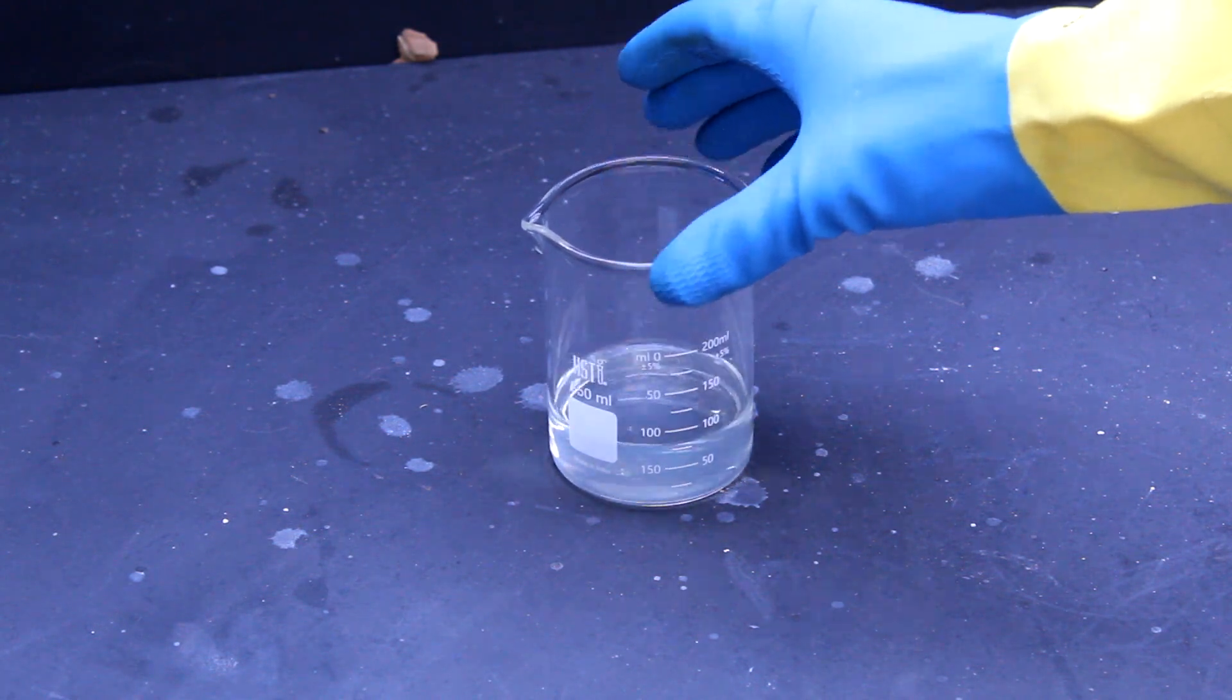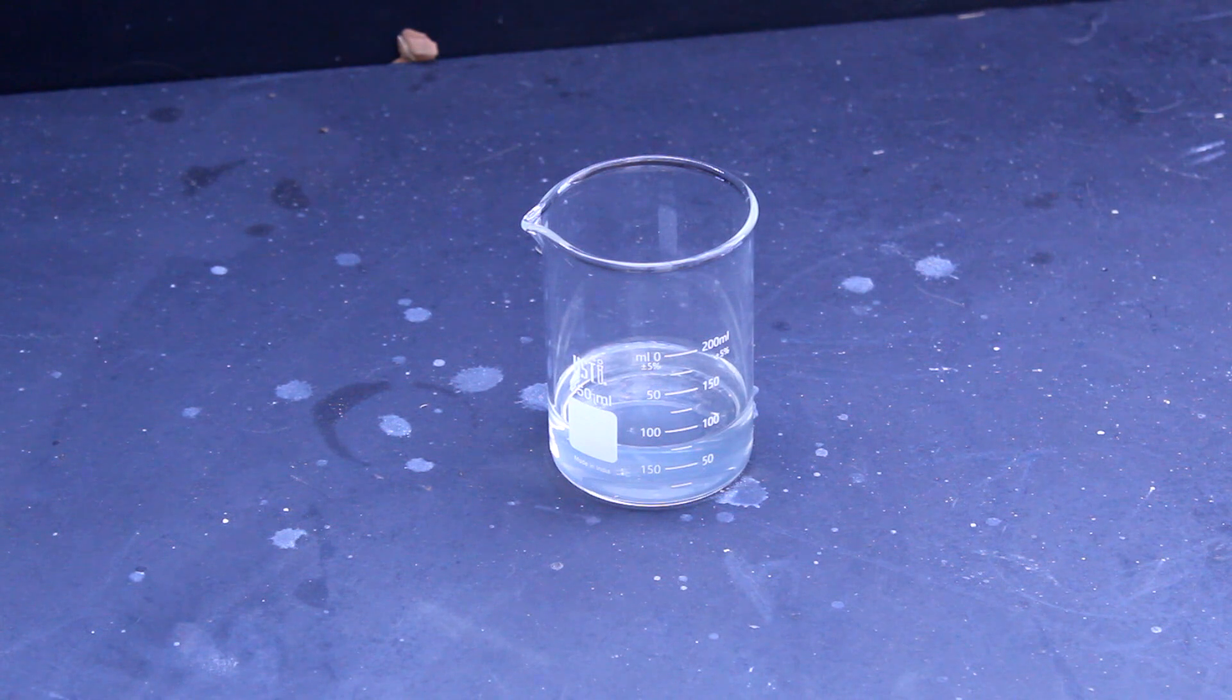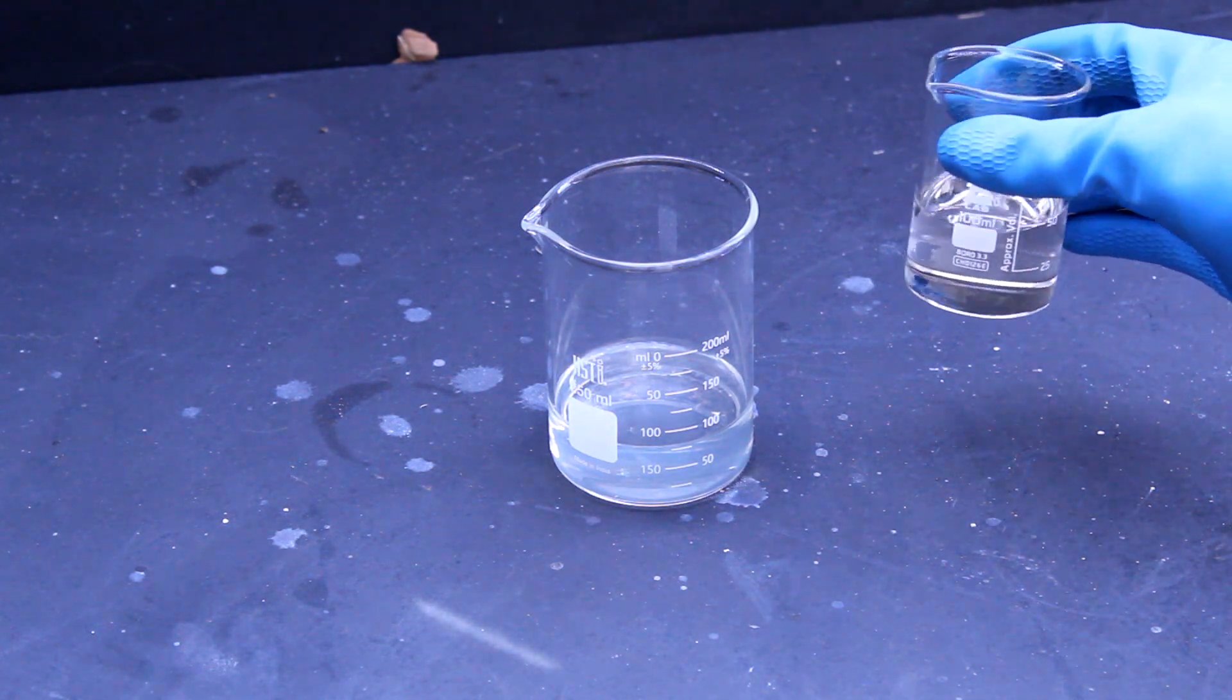And now for the fun part, recreating the glass but as a slime. To do this, I'll be using sulfuric acid, but any acid will do.